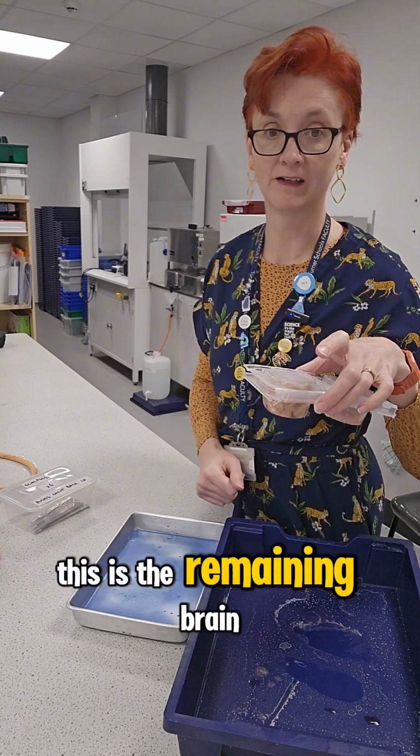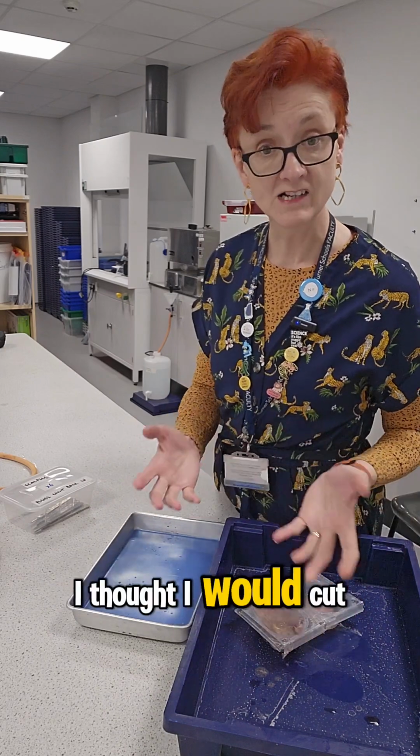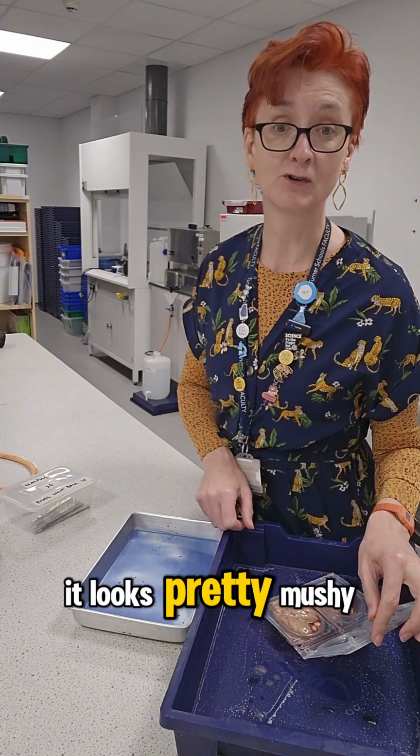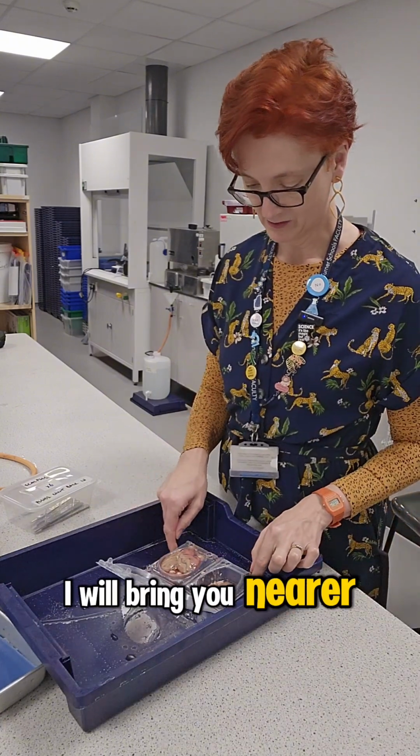This is the remaining brain from that. Thought I would cut it up in front of you and we'll see if it's mushy or not. It looks pretty mushy. I will bring you nearer so you can look.